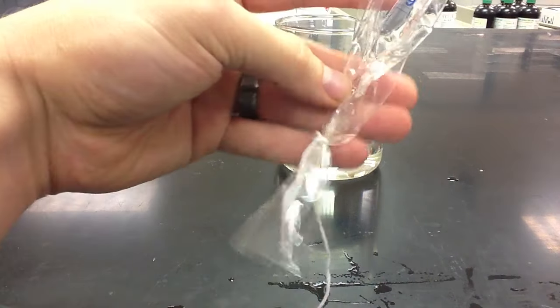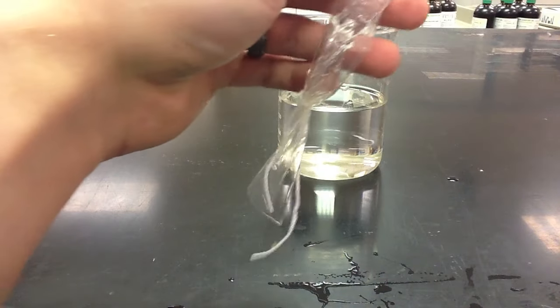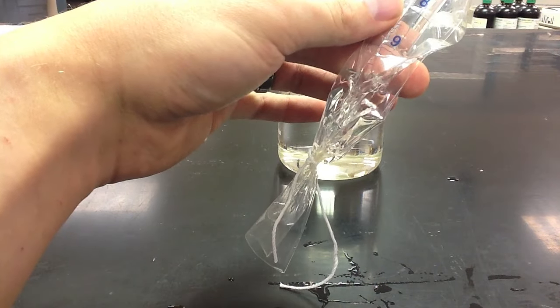Be sure that you work the liquid into the bag so that the bottom part of the bag opens up. If not, the liquid's going to overflow and go out of the bag.